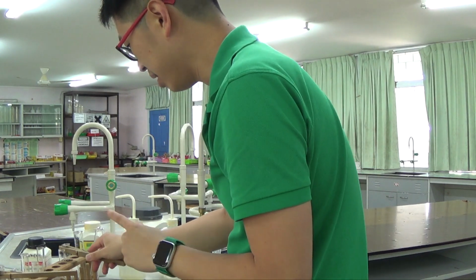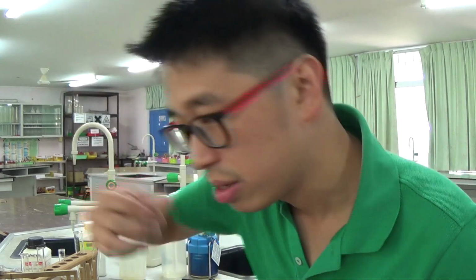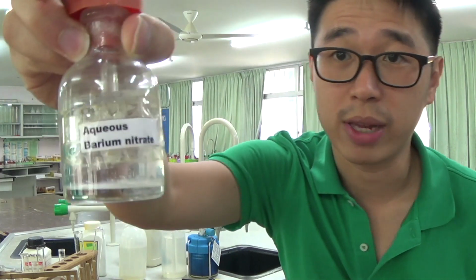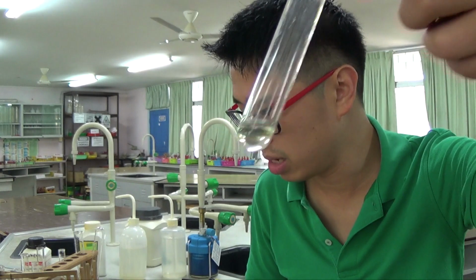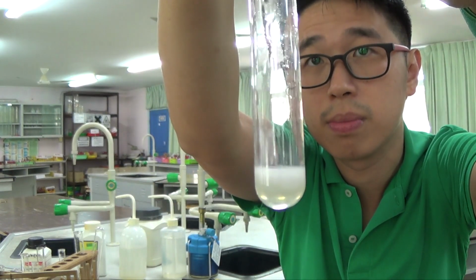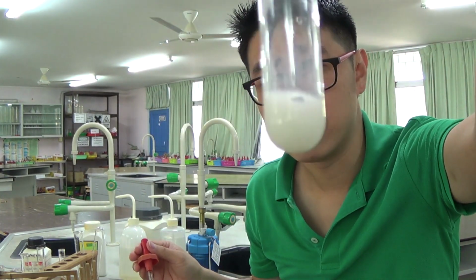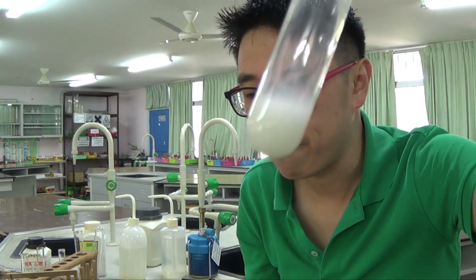I think because I have sulfate, I'll just show you the test for sulfate first of all. So I know the bulk of this tutorial video, I said earlier, was to do with the test for ammonium ion. So this is barium nitrate. This was the solution that has the double salt. Colorless solution of barium nitrate. Now you can see what happened? You cannot see my face now, you cannot see my eyes now because you cannot see through it, because this is actually a white precipitate.